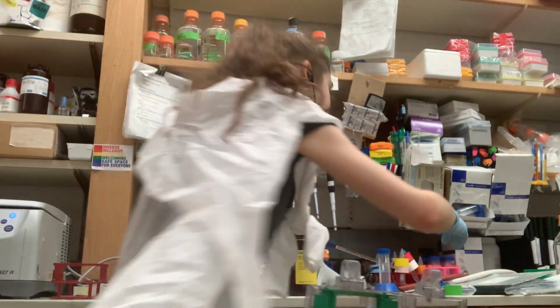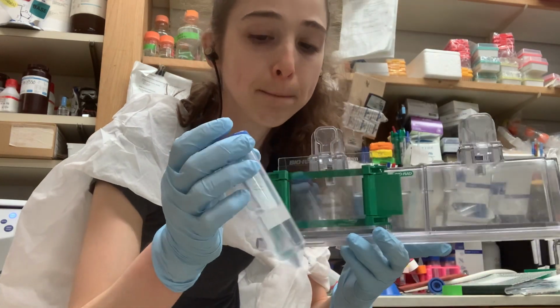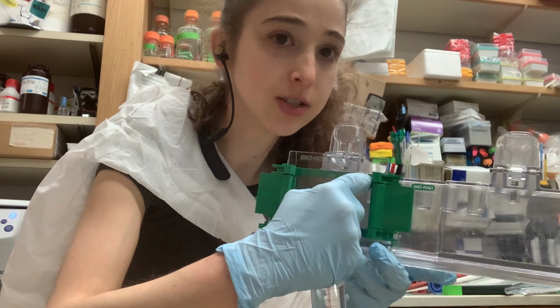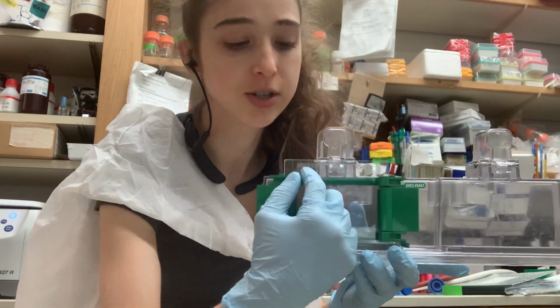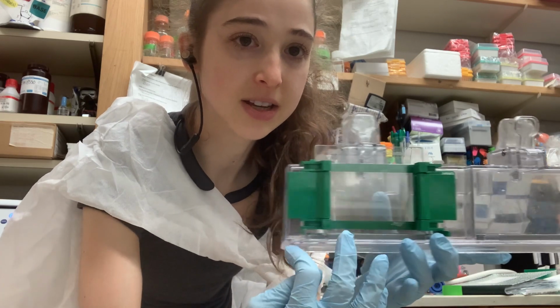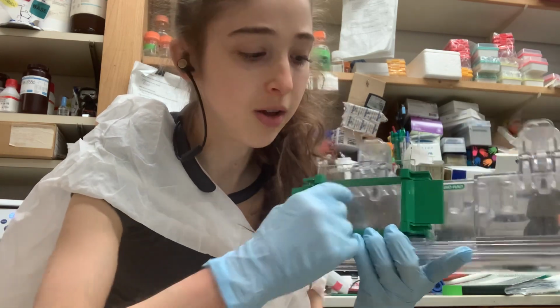And then I have this ready to go too. I keep a big 1 ml pipette with about a ml of isopropanol, and I just make a layer on top. Basically the isopropanol is not soluble with the other mixture, so it's going to form a layer on top, but it's going to both keep the top from drying out and help you get a nice clean line. So you can kind of wiggle it a little. Then you leave that while this part's drying.